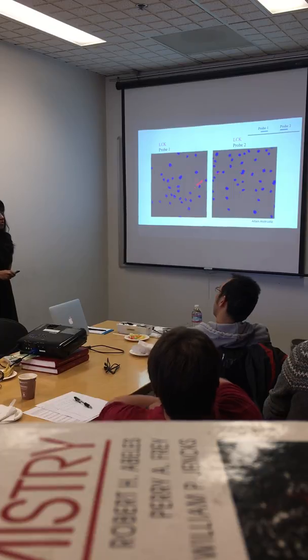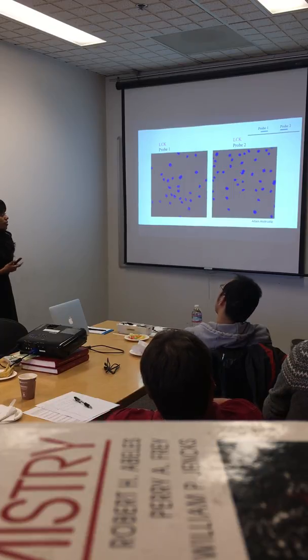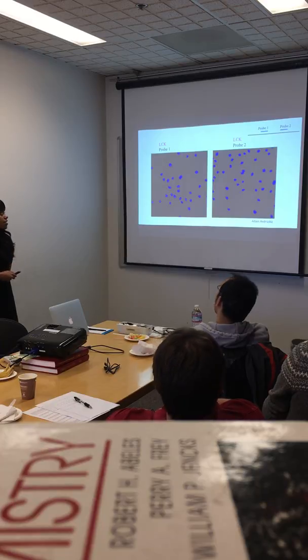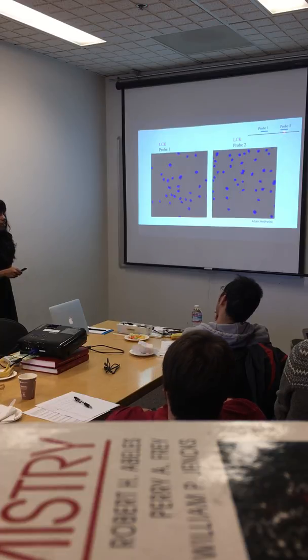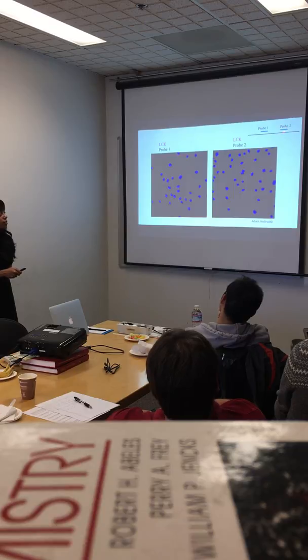So probes have varying efficiencies. A couple of reasons why this could be happening: probe 1 targets a specific region here, which could have been more accessible than this one. It's possible that this region has secondary structures or bound proteins that prevent probe 2 from accessing it. The other option is that these probes tend to form dimers with themselves or with other probes, and they're not able to bind to this region.